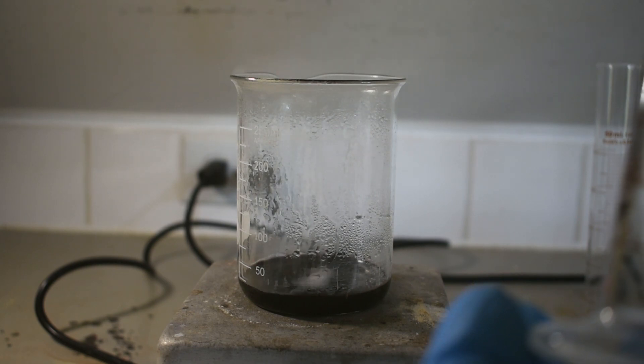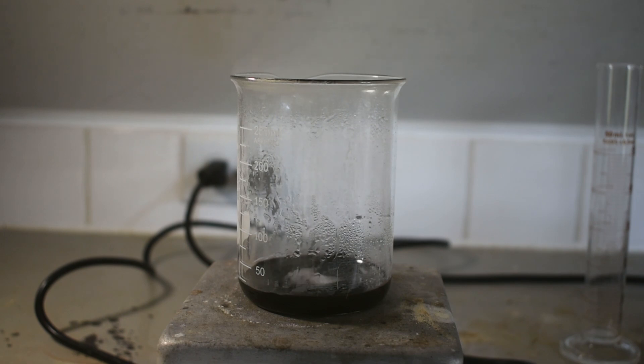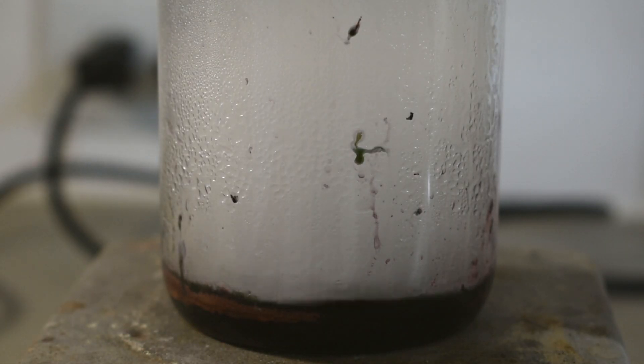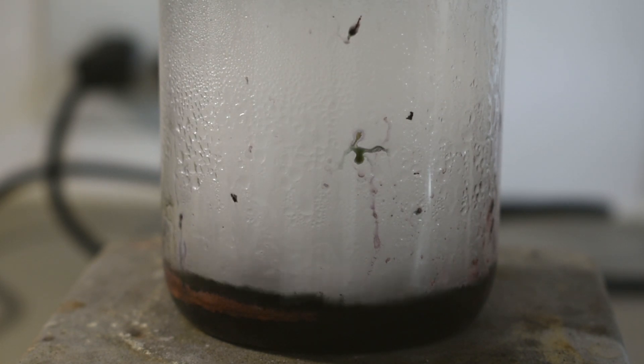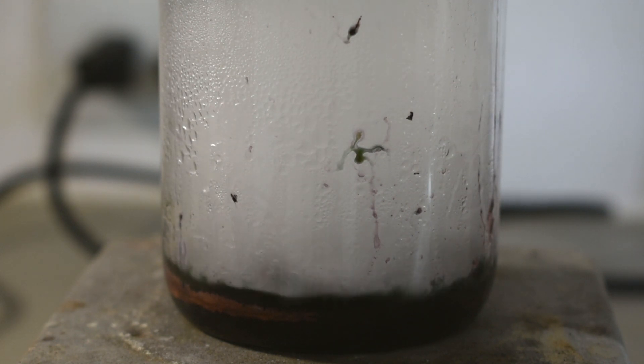Now, this is a very bad idea, as you'll see right here. That is why wearing safety goggles is such a good idea — getting any of that hot solution in my eyes would have really sucked. What I ended up doing instead is dissolving the ethylenediamine in an equal amount of cold dimethylformamide. Adding this dropwise to the mixture was much calmer than just the straight ethylenediamine.